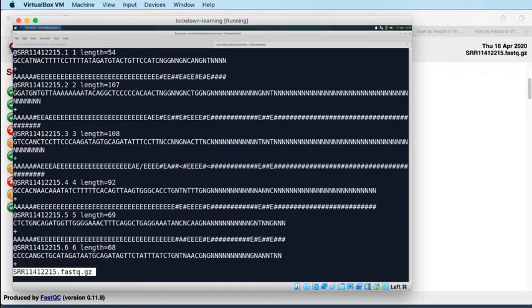This is ASCII encoded. It's actually numeric data, but it's encoded as ASCII text. So you get 1 character per base of quality information, and it is possible to translate that letter into a number. Different FastQ formats from different eras will be encoded in slightly different ways.